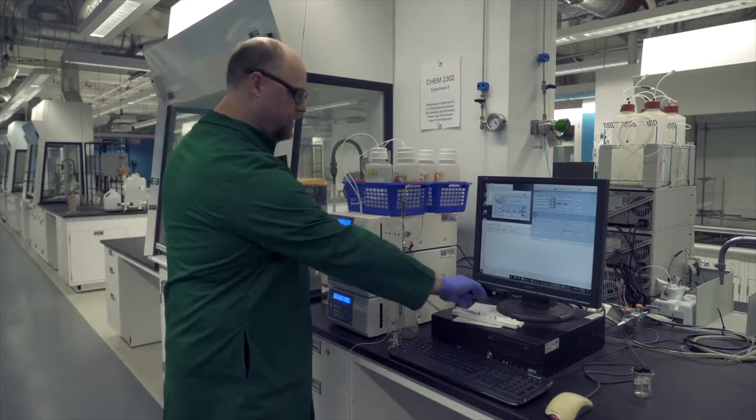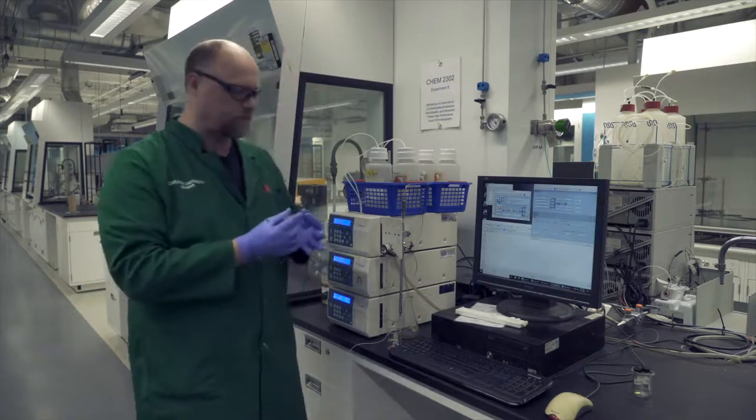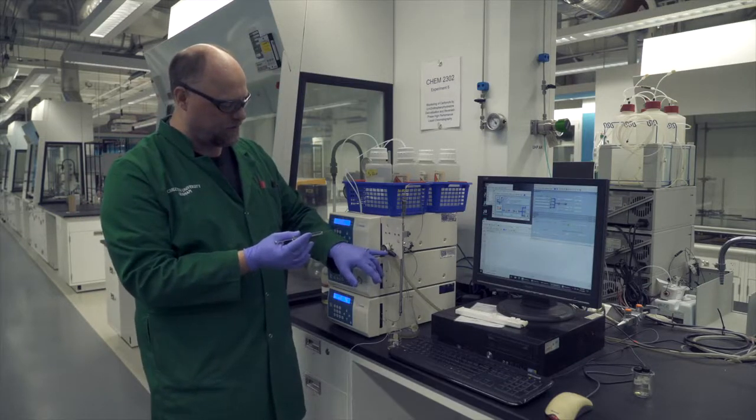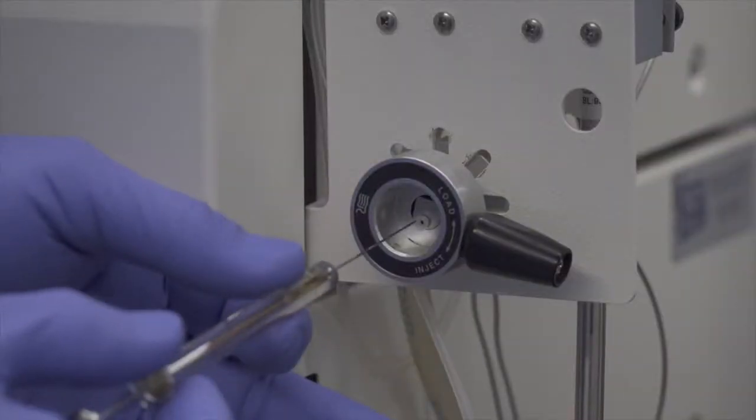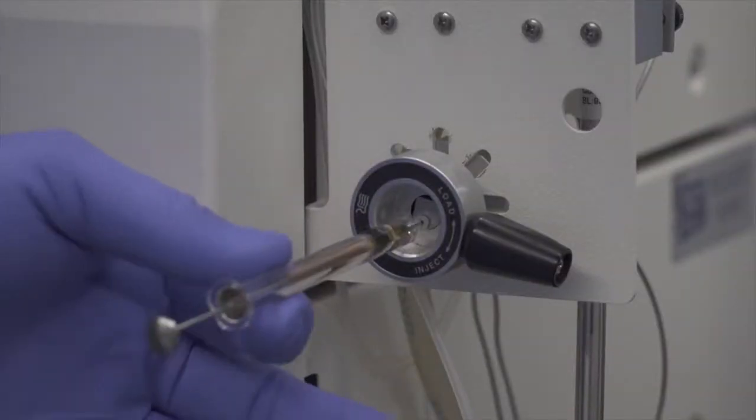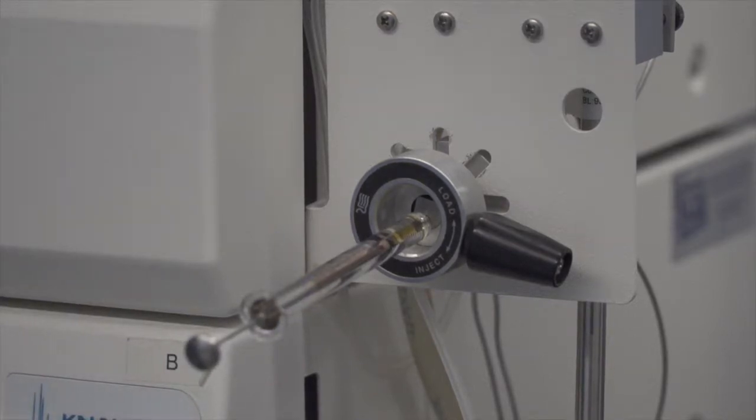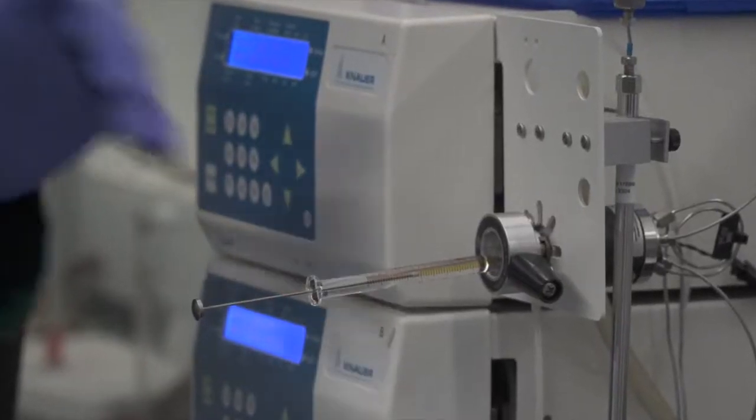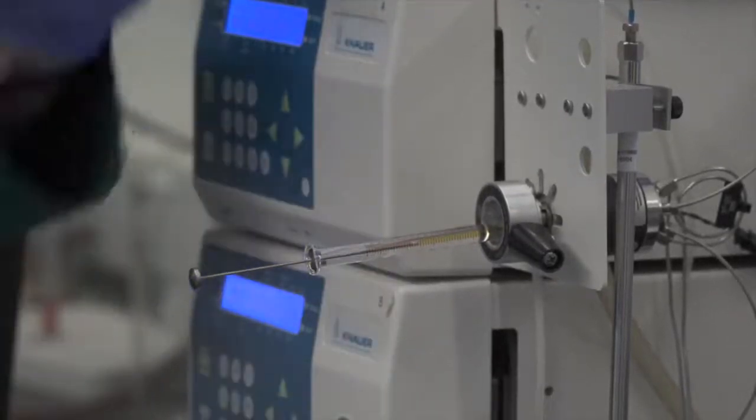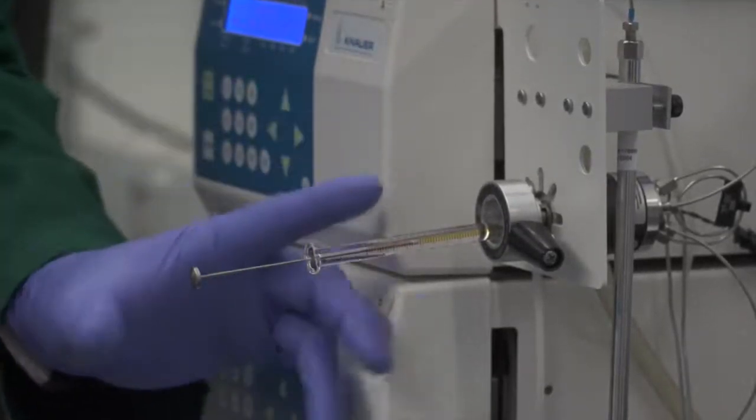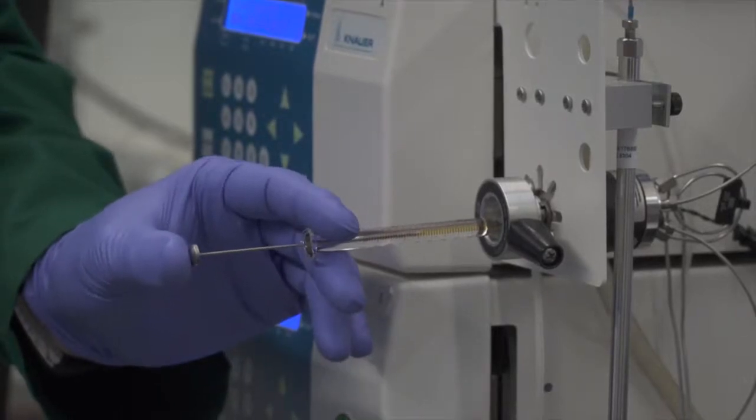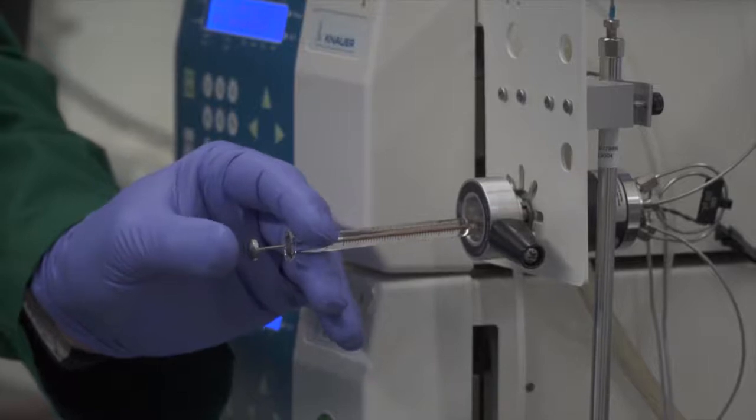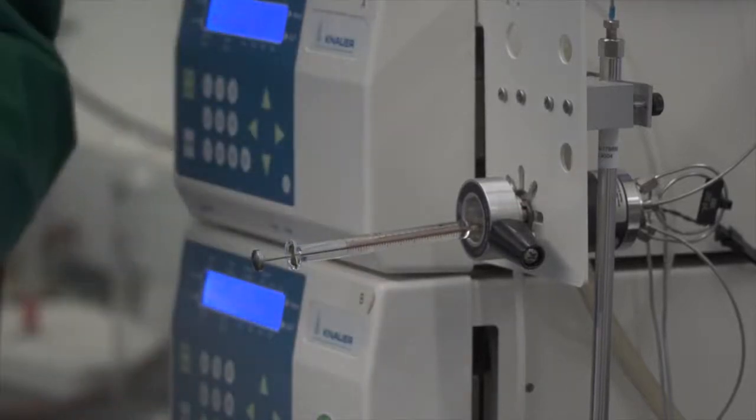What you're going to do is you're going to take your syringe that you prepared with the sample, and inside the injection port, there's a small little opening that the syringe will insert into, and it just goes in right like that. You want to push it all the way in so that the syringe is all the way there, and the syringe will hang there by itself perfectly fine. Then what we're going to want to do is we're going to want to inject the contents of the syringe onto the sample loop or into the sample loop. We can just inject the contents of the syringe, and that'll fill the sample loop on the back of the injection port.